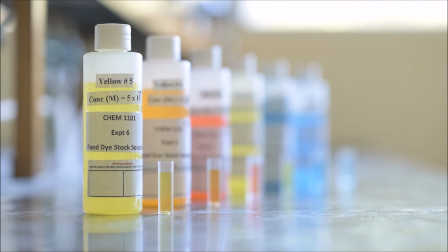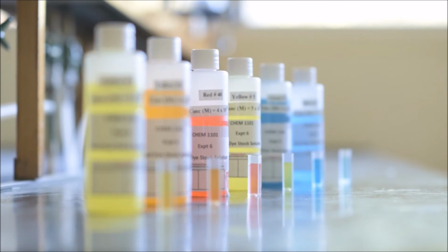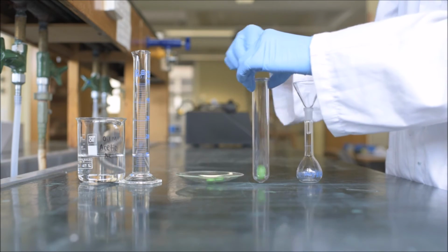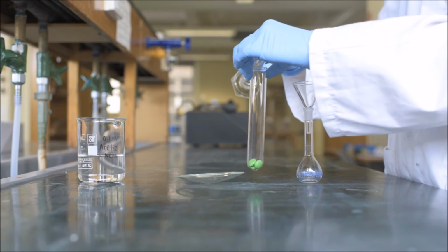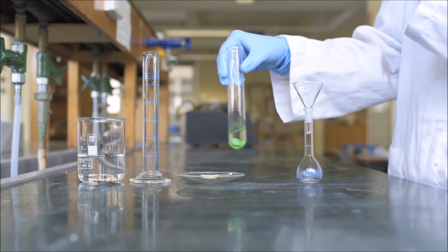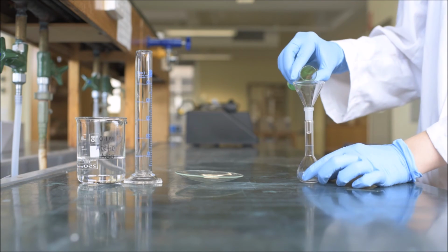Each group will be allocated a single dye and figure out an absorption spectrum for this dye. You will then combine your results with other groups to figure out which dye is in the M&Ms and what its concentration is. Once you know which dye to use for your standard addition, add 3 green M&Ms to a test tube and then add 0.1 molar acetic acid to carefully dissolve the dye. Take care to dissolve all dye from the M&M but none of the chocolate underneath. Your solution must be clear to obtain an accurate UV-vis reading.